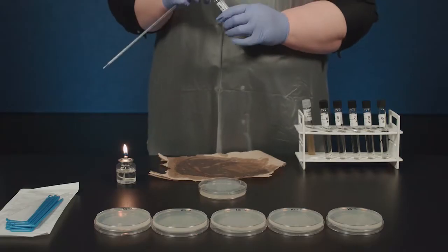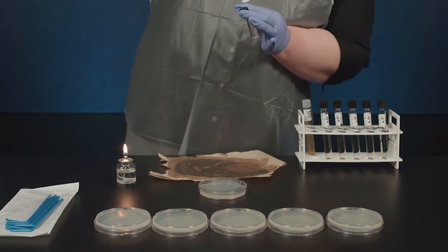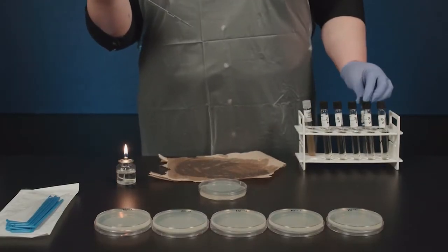In microbiology, a serial dilution can reduce the concentration of a sample to a manageable level while still being able to calculate the original concentration.